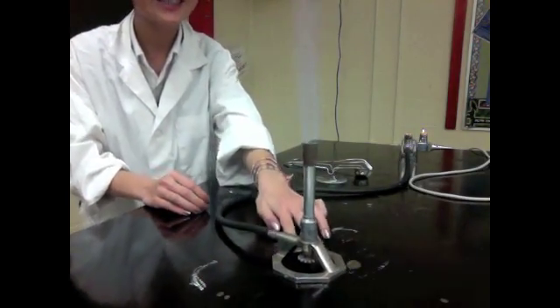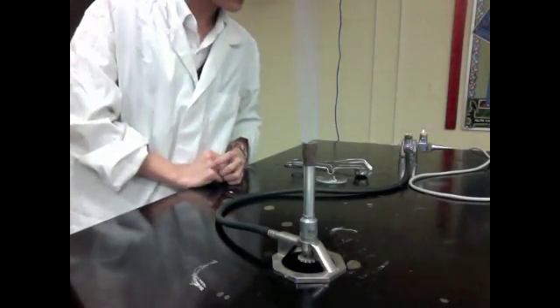As you can see, there's a blue flame. This means that the flame is hot enough for us to put the magnesium ribbon in.